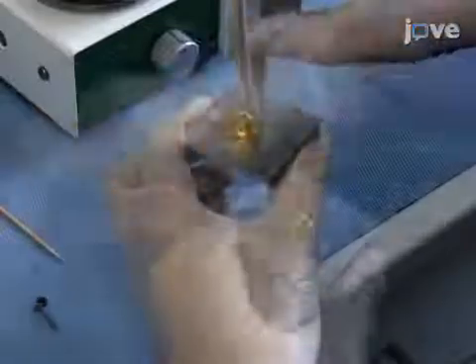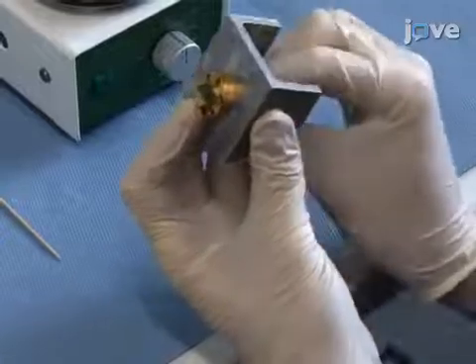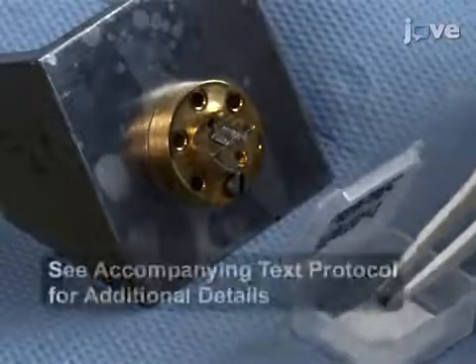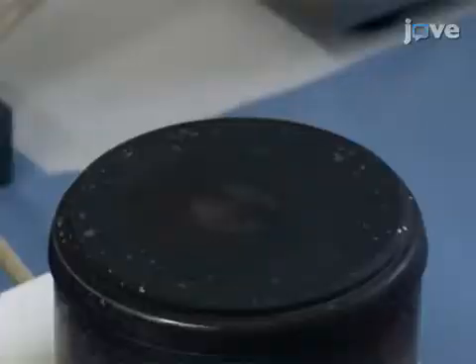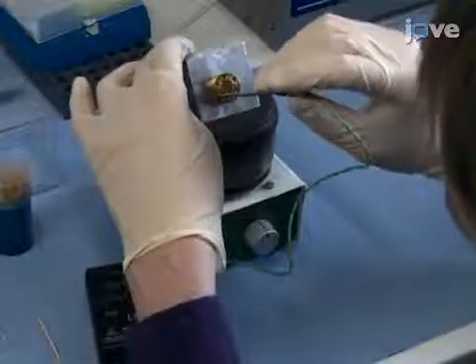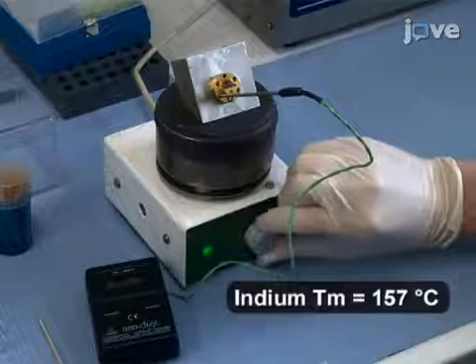To begin, mount the 60-degree pretilted sample holder onto a metallic socket. Then put a 0.5 mm thick piece of indium foil on the sample holder and place the clean sample on top. Next, place the socket onto a heating plate. Switch on the heating plate and heat up the socket to 150 degrees Celsius in order to make the indium foil ductile.